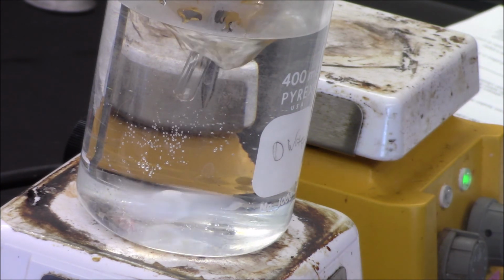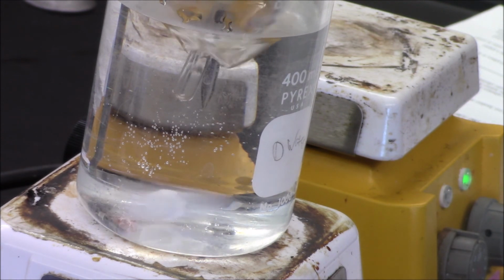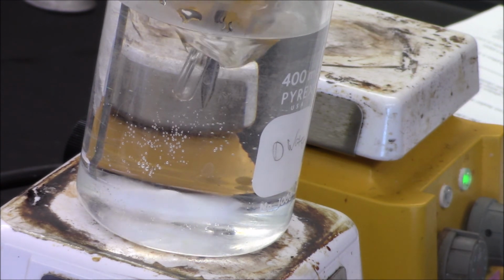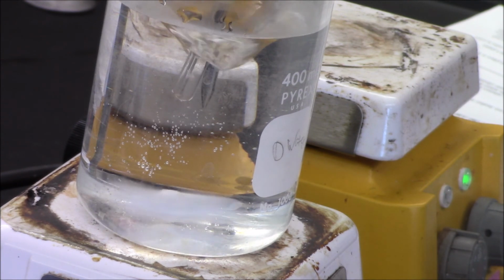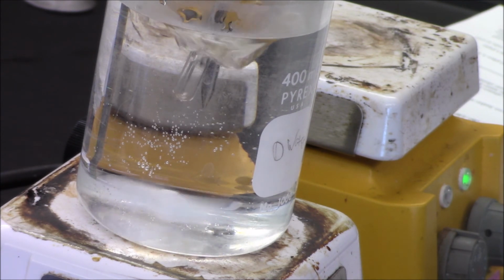54.0. The only thing we can hope for is that the whole thing doesn't evaporate away before we reach the boiling point. But it's going slow and steady. And the temperature is also dropping slow and steady. So we might be here for another 2 minutes just watching these bubbles. It's kind of hypnotic. You find your Zen place.